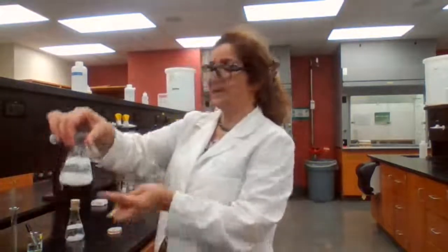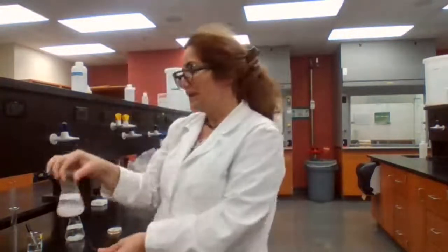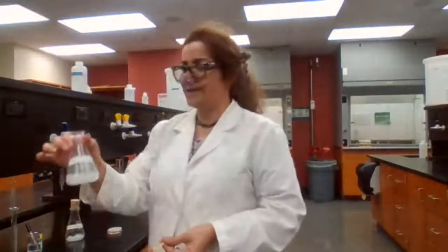When the solution is acidic, my acid component of the mixture has precipitated, and you see that it is cloudy. What should I do to make sure that I get complete precipitation or complete recrystallization?